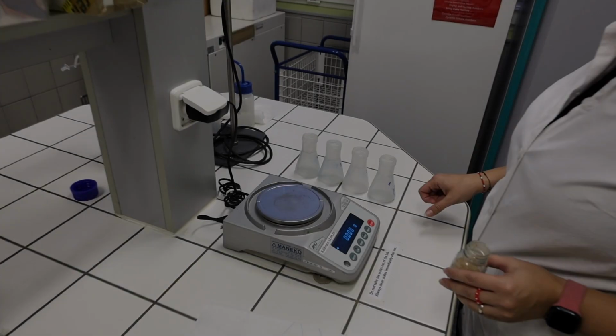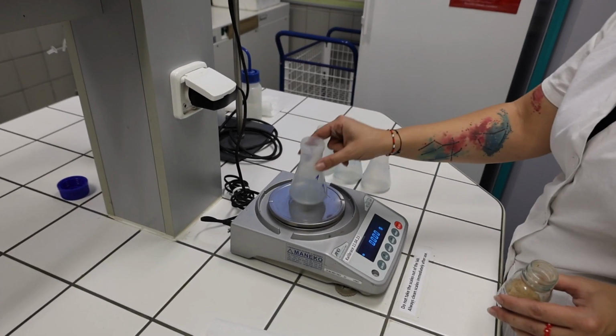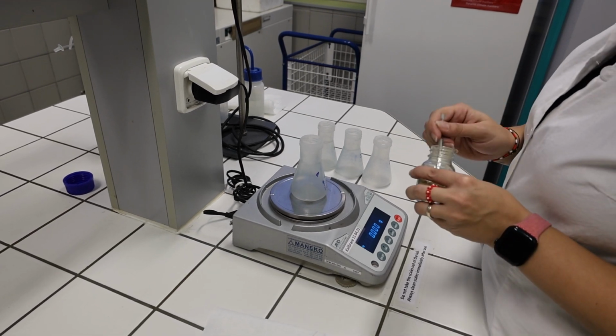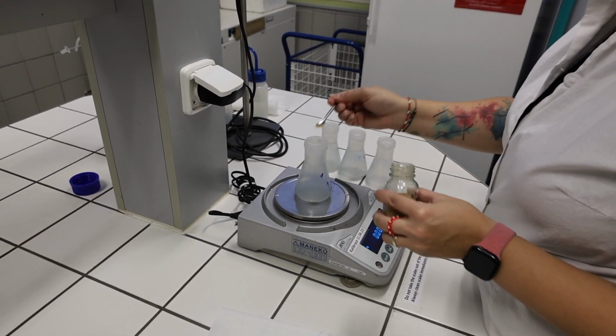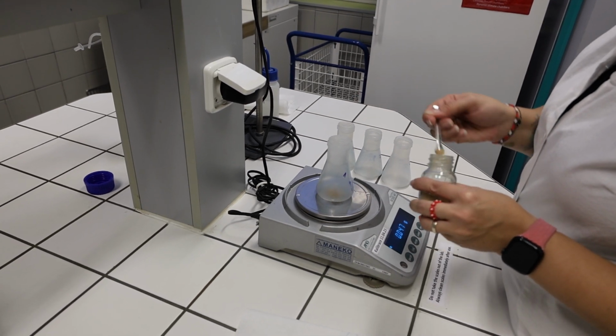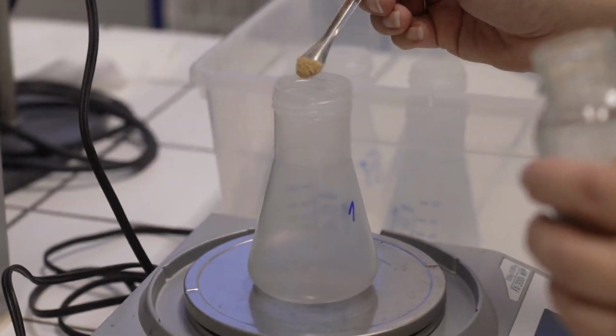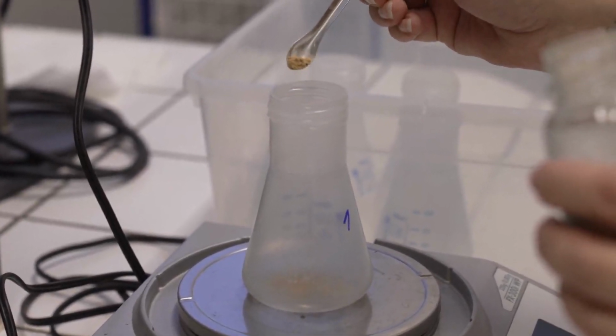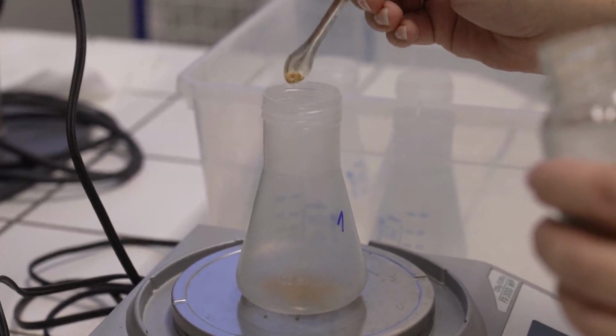As the manganese peroxidases are extracellular enzymes, soil samples can be analyzed in a freeze-dried form. Soil should be ground and sieved through a 2 mm sieve prior to analysis. The common mass of sample for the analysis is 200 mg. Plastic Erlenmeyer flasks are suitable for the extraction.